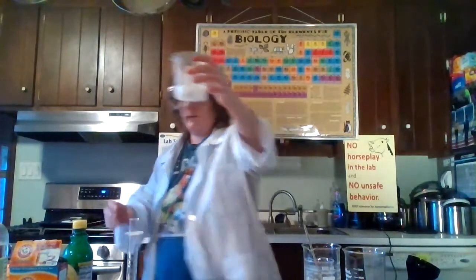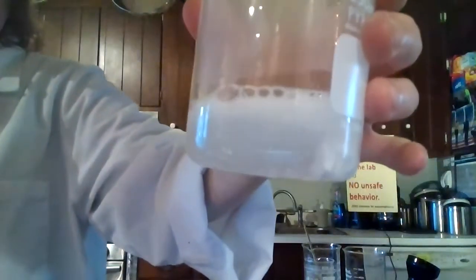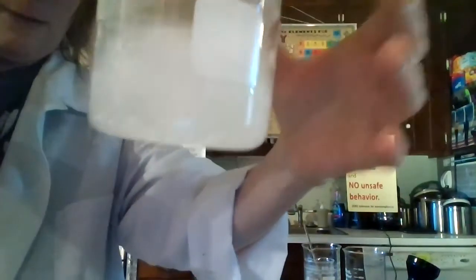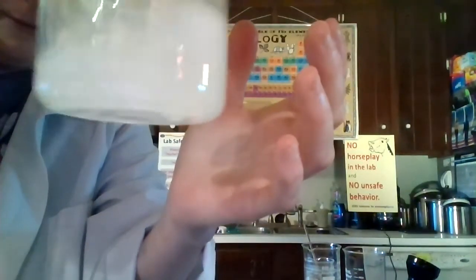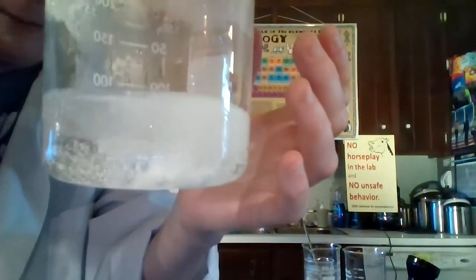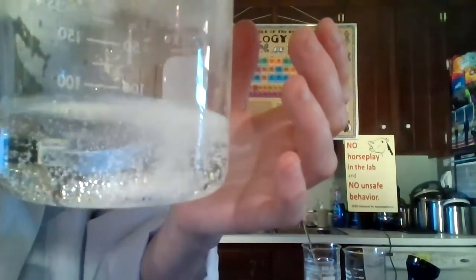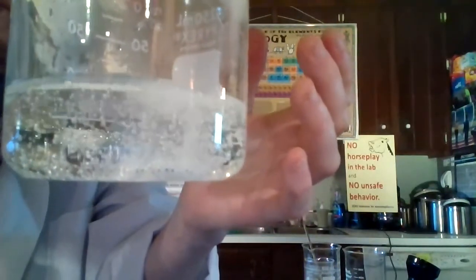You can see there's some fizzing action. You can see that there's still a little bit of those tablets in there, but they are disappearing rapidly. See the little bubbles coming off? It's releasing something — I'm not going to say what. That's up to you. You don't have to be specific.